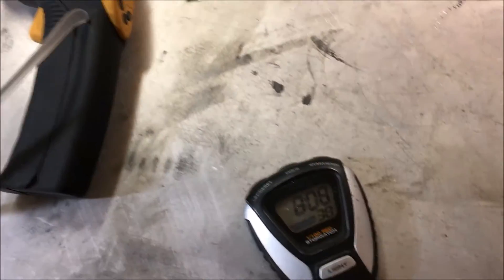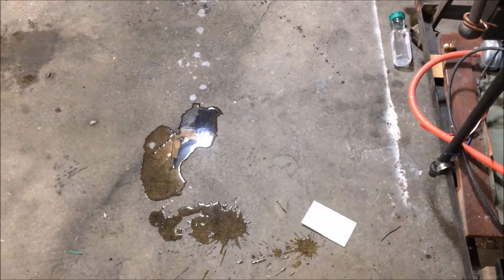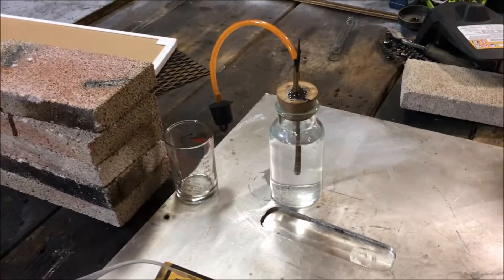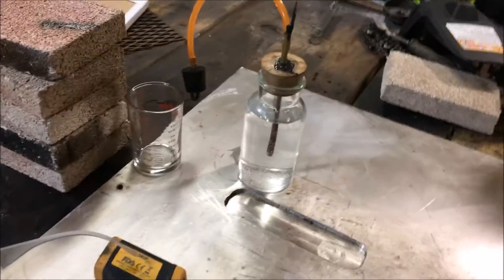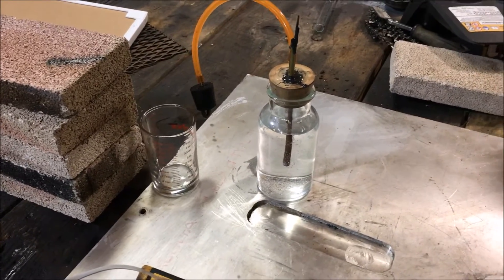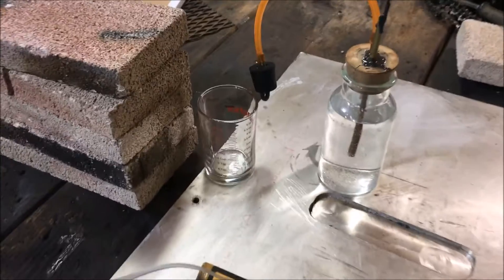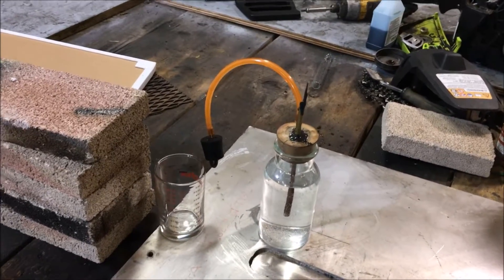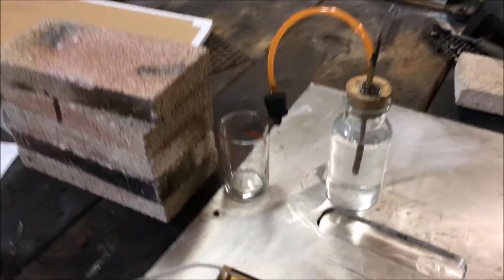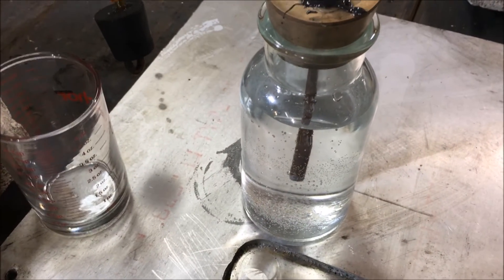I think we are at about 50 minutes. It doesn't take that long if you start off with a warm solution — the solution has to be warm for it to be activated. Under no circumstances should you try this. This is stupid dangerous. Not only is the caustic soda capable of blinding you and causing extremely disfiguring wounds, but the hydrogen gas buildup could blow up your entire house. You've seen how igniting this flare caused that extremely loud explosion.